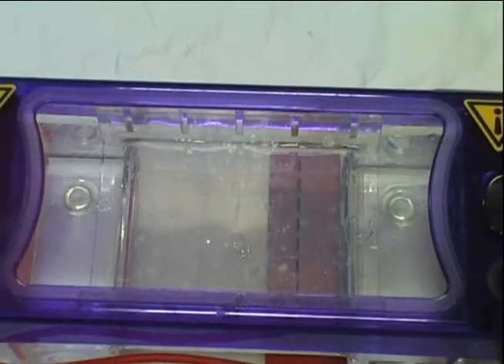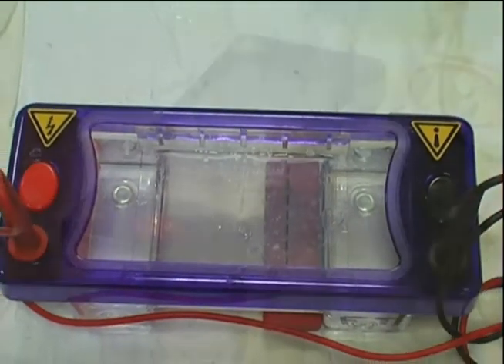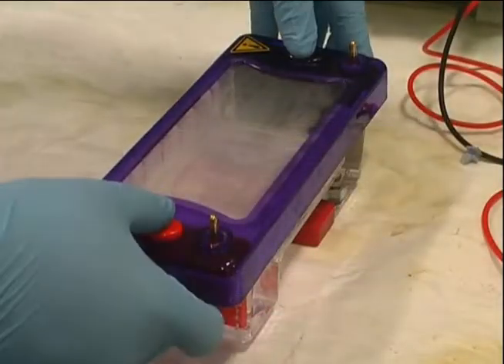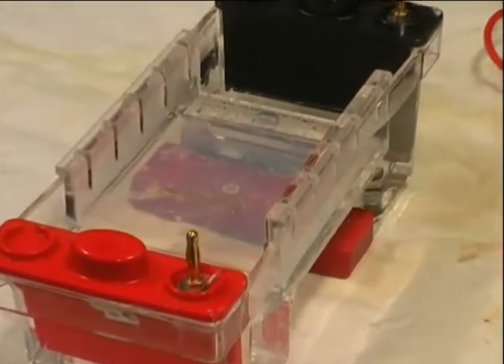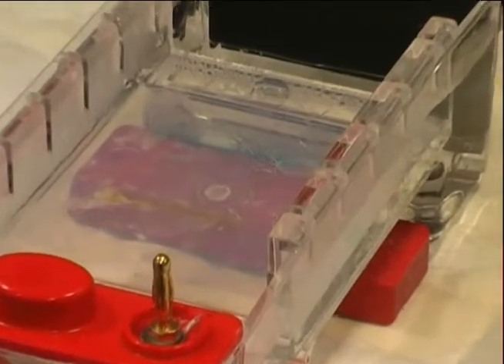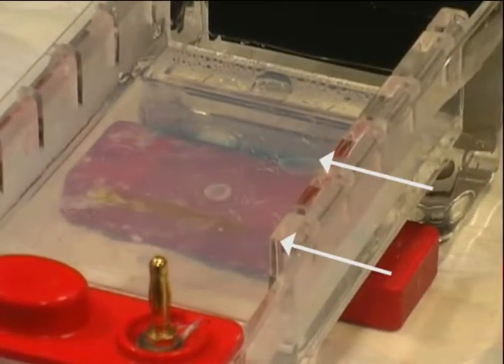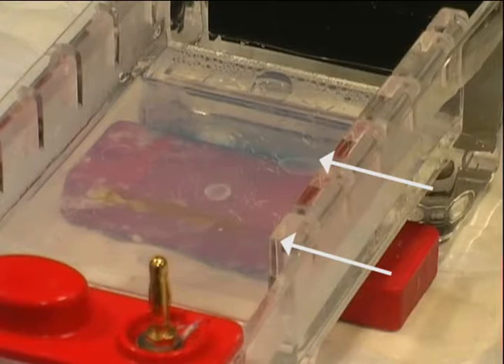After a period of time under electrical current, the power pack is switched off. These days, PCR sample dyes have two colors, seen in the film as yellow and blue, which can be used as a rough measure of how far the DNA is run through the gel, without having to constantly check by removing the gel from the tank.